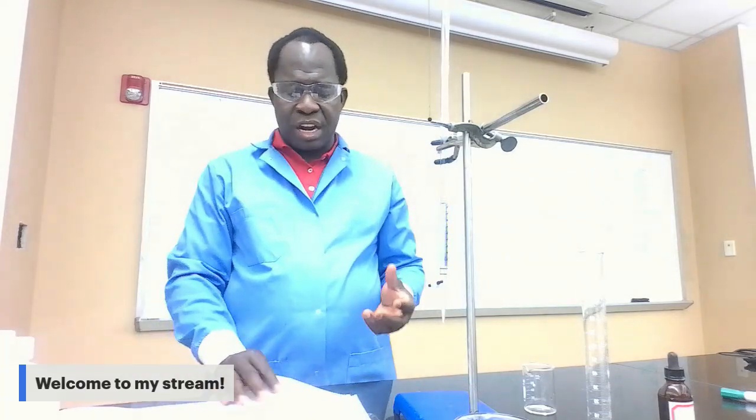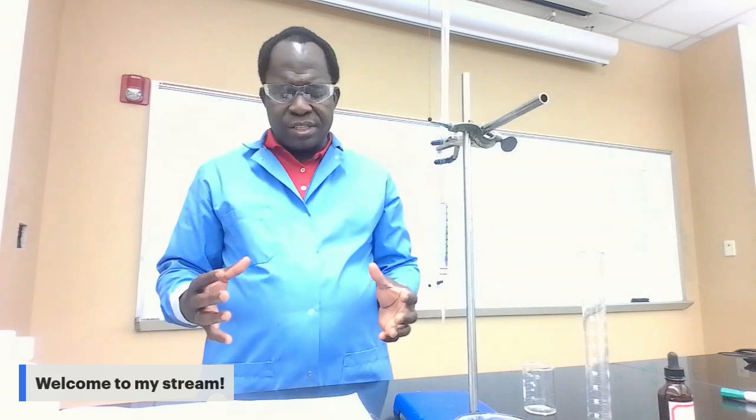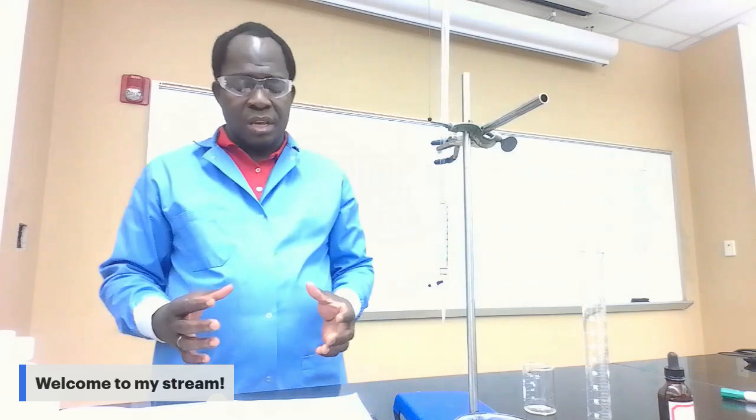You record the volume of HCl you used for the titration of the three beakers. By the end, you're gonna add the volumes. For each titration, you have 3 different volumes of HCl. You add them up and divide by 3, so you get the average volume. You're gonna use the average volume of HCl to proceed to the calculation part of the lab, which will lead you to the determination of the molar solubility and the Ksp of Ca(OH)2.